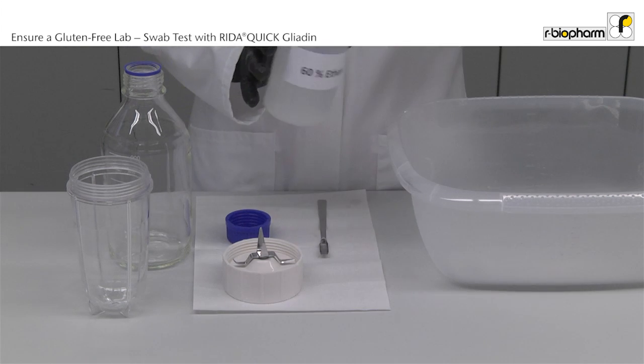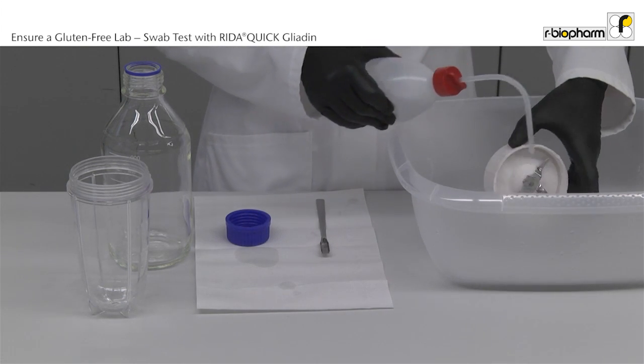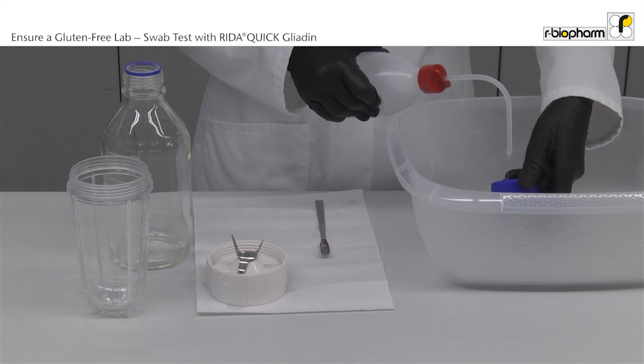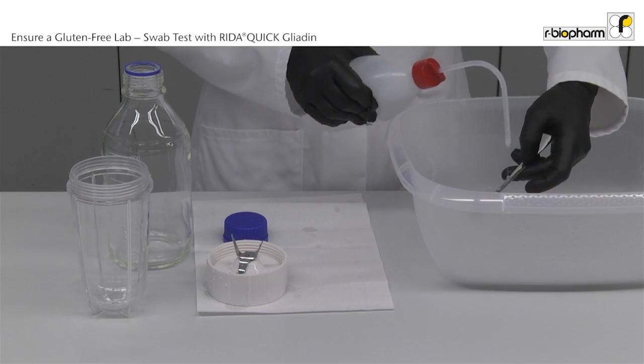Cereals like wheat, rye and barley are very common, and the cereal dust can contaminate equipment and surfaces easily. Therefore, it is important to avoid this cross-contamination. Thoroughly clean spatulas and bottles, including lids, with ethanol.